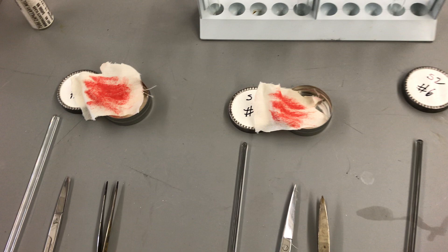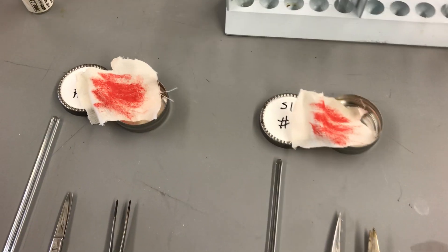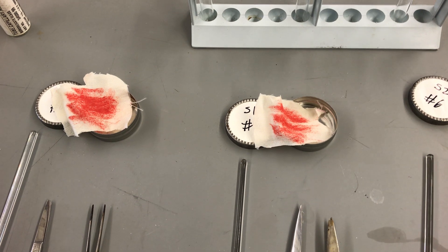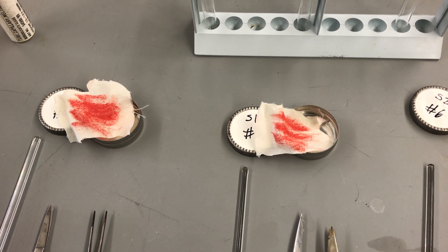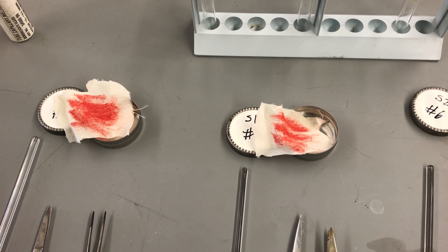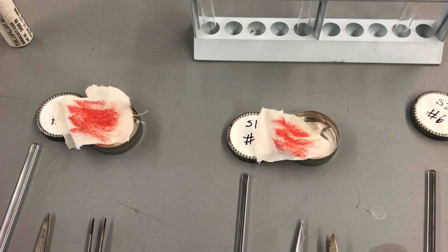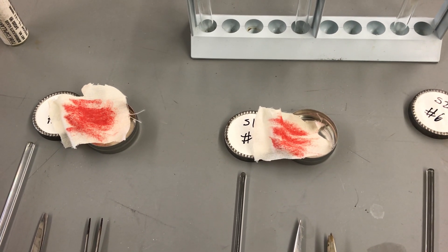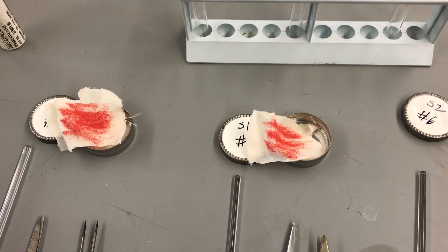Just because suspect one is very similar to our crime scene in visual appearance does not mean they have the same chemical makeup. That's why we're doing the chromatography lab — to make sure that the chemical makeup of the lipstick samples is the same. We'll hopefully be seeing that, or not, depending on the type of lipstick, as we do the chromatography experiment.